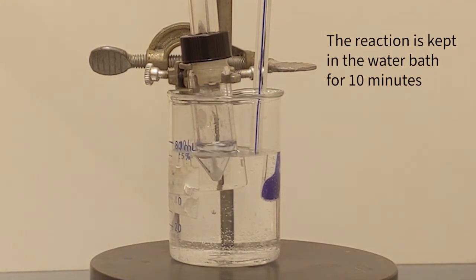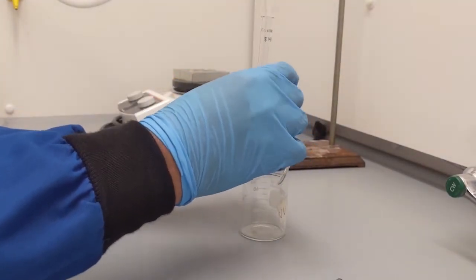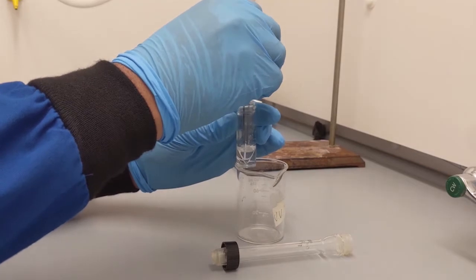After 10 minutes, remove it from the hot water bath and allow it to cool to room temperature in a beaker so that it does not tip over. After it has cooled to room temperature, take off the air condenser and with the help of a clean forceps, take out the conical spin vane.